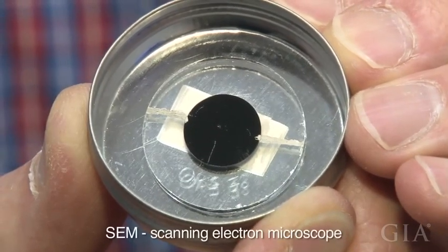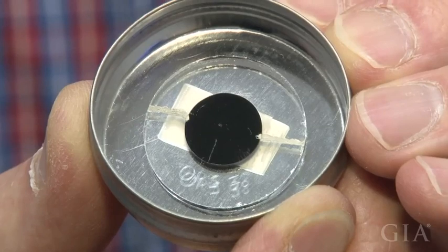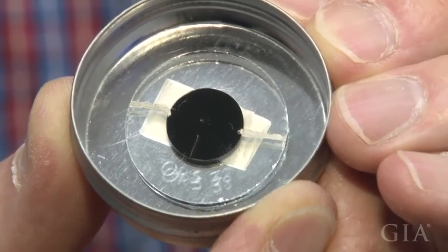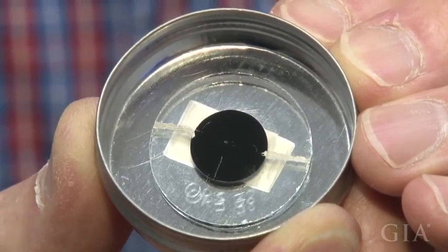And then we take that to the SEM and we're going to actually verify that it's an inclusion, that it's a sulfide. We want to see two things: that it's not a piece of the cracker, either tungsten carbide or steel, which it's so small at that point your eye can't really tell that it's a sulfide. Sulfides will look a little bit brassy or a little bit yellowish. But it's so small that your eye really can't pick up enough of that color to see what it is. You just see a bright object, a bright point.